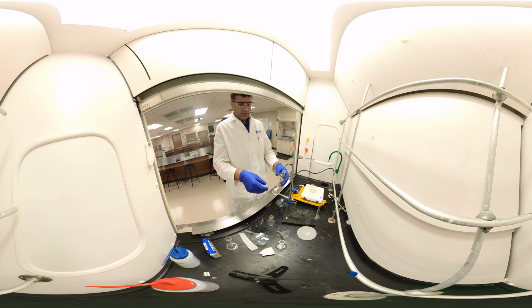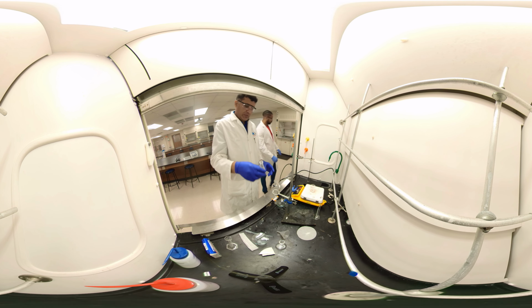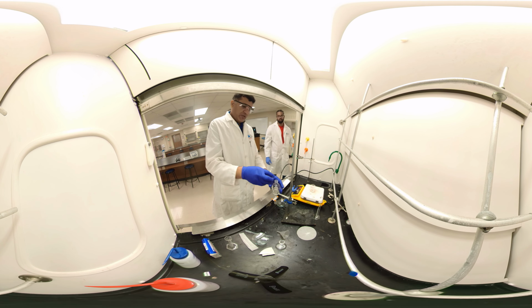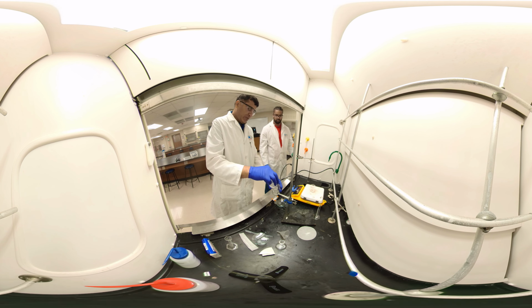So this one here, we put it here. It's closed. So I don't need a funnel. I think I'm confident to pour it. If you are not sure, just use the funnel, okay?